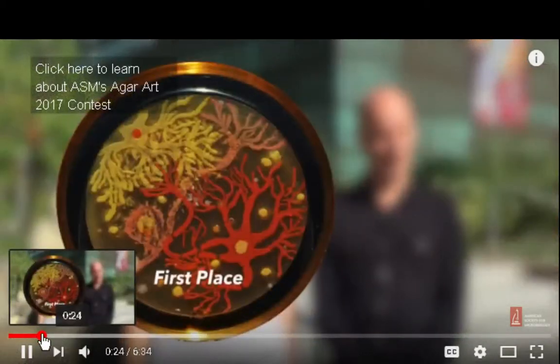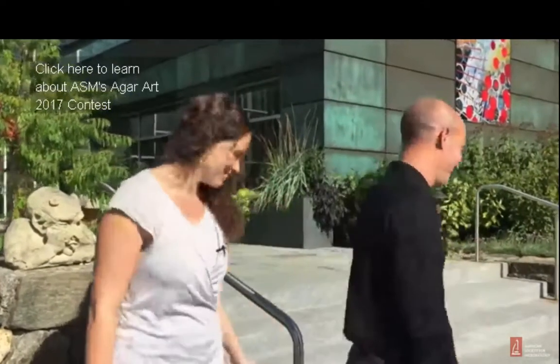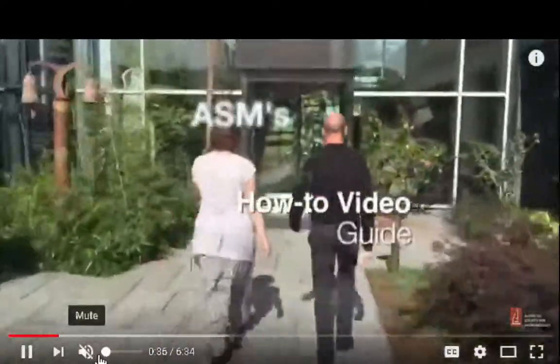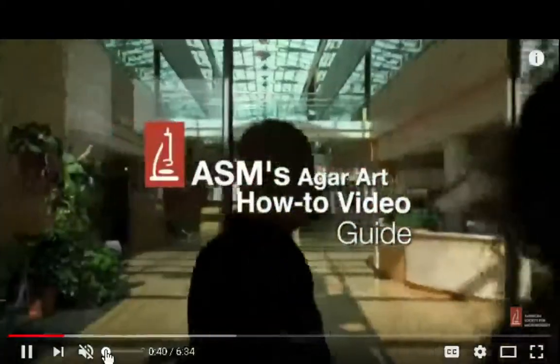15 ASM's Agar Art Competition, both the first prize and the People's Choice Prize. And today we'd like to show you how to make Agar Art using bacteria. Well, they're using bacteria, so they're not using spores. Oh, I know what they're doing. So they're just spreading the art across the dish.